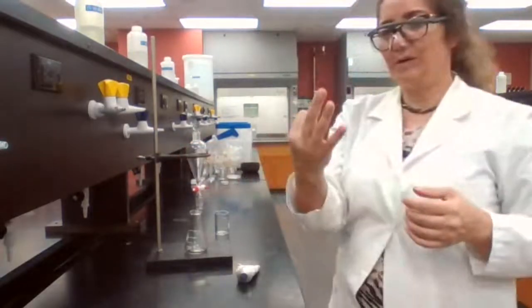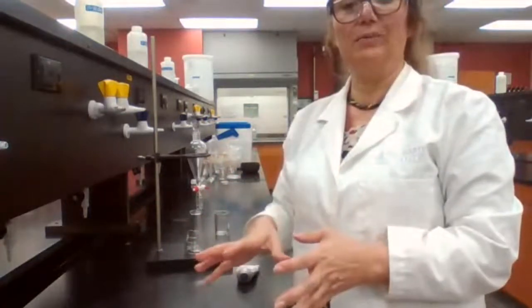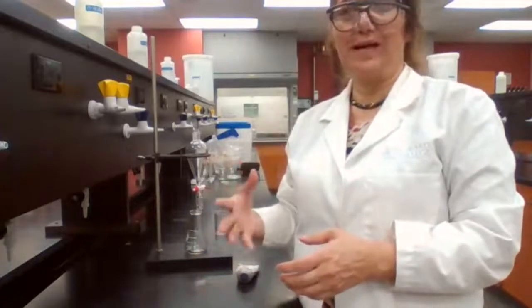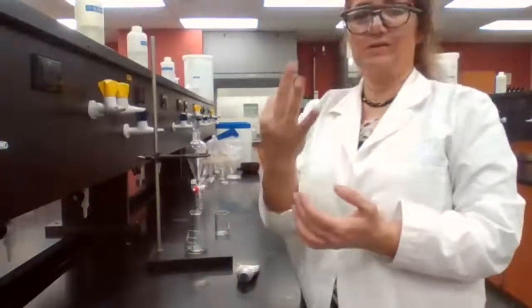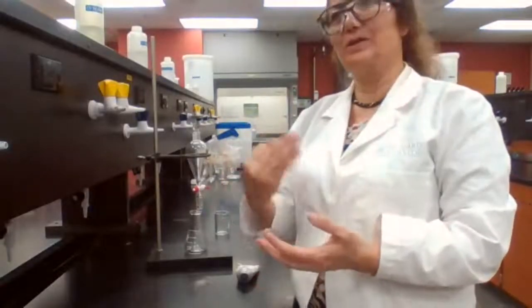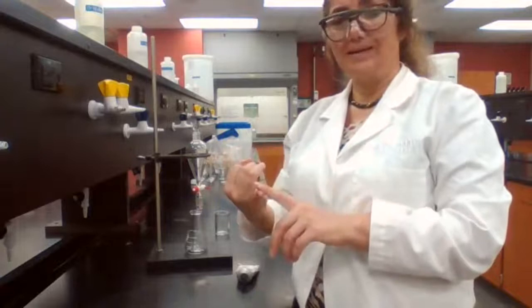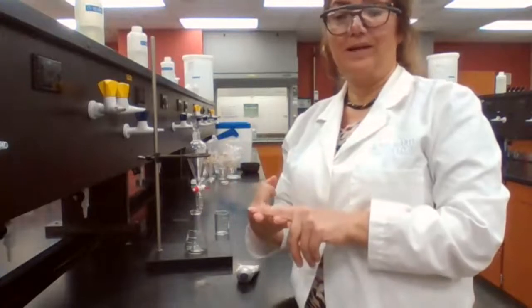So you heard like 3 words from me that's going to stay with extraction. You're doing extraction multiple times in organic 1, and multiple times in organic 2 lab. So for extraction, there are 3 words to remember. For easy to remember, always follow the procedure, but these 3 words: shaking, that's after adding your solvent, shaking, venting, and separating.